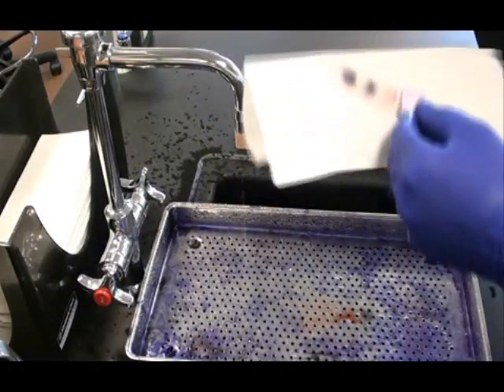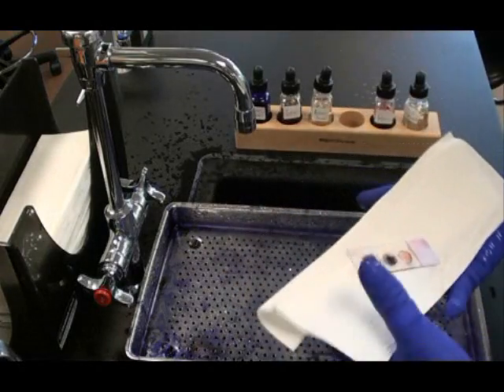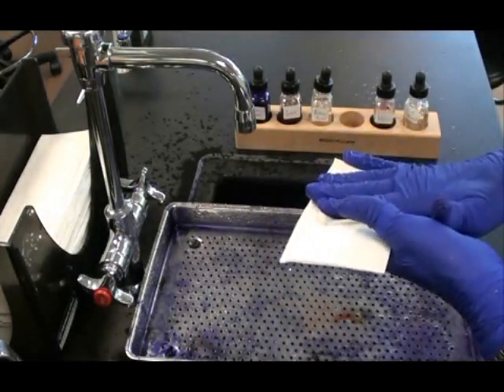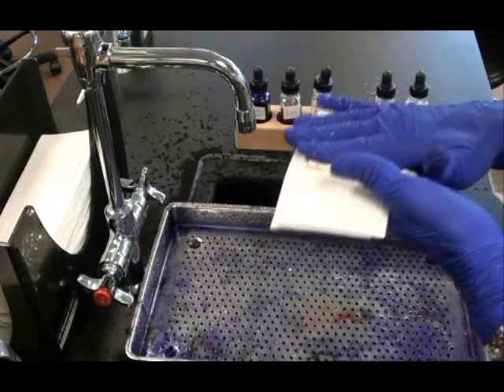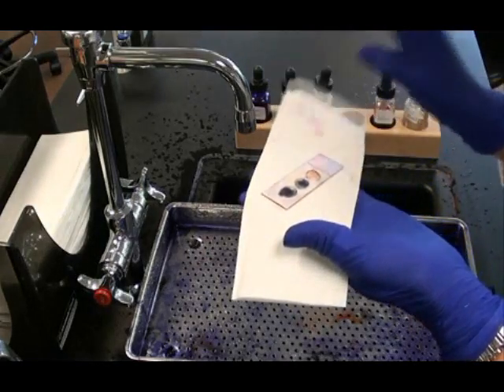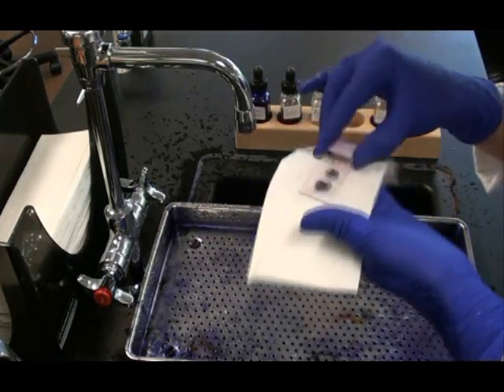I want to gently blot this slide dry. Don't wipe it. You could wipe the bacterial smears off. So gently blot. And then you'll be ready to look at that slide through the scope under oil immersion. All done.